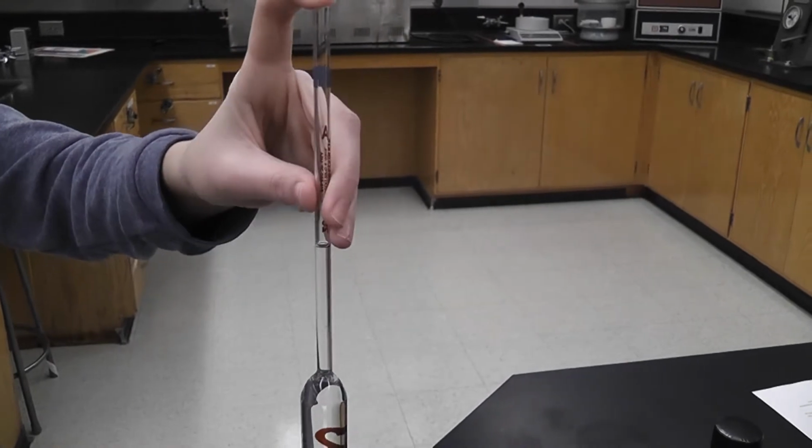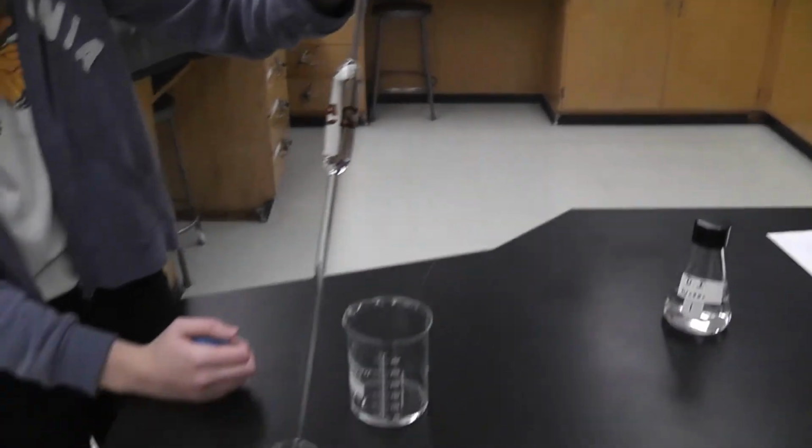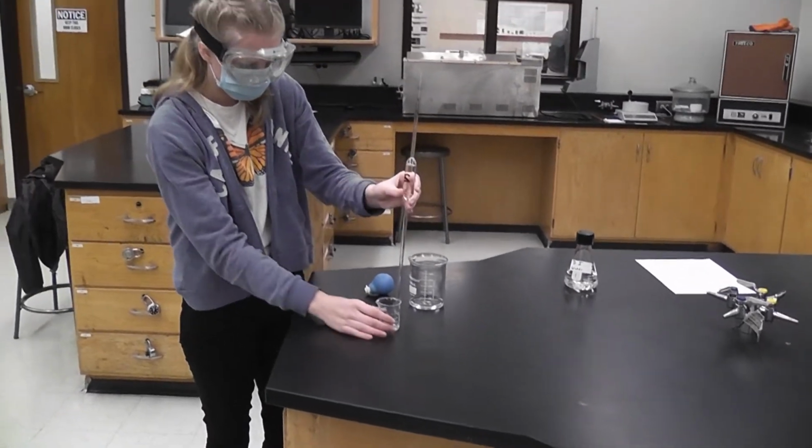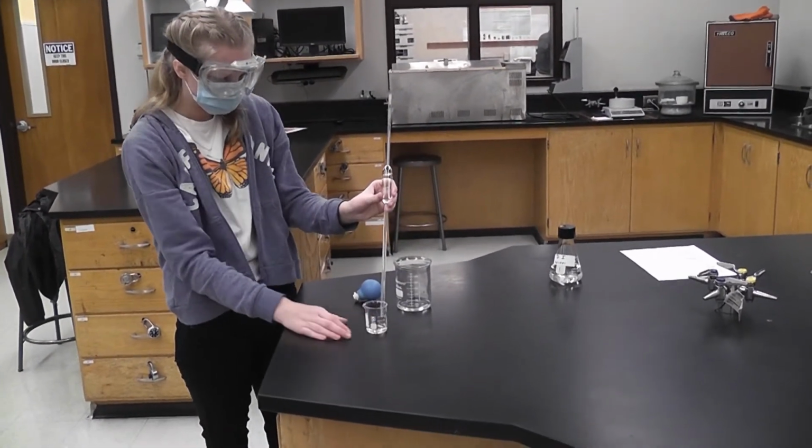And then I transfer that 25 mLs into my separate beaker, and I let it all the way out.